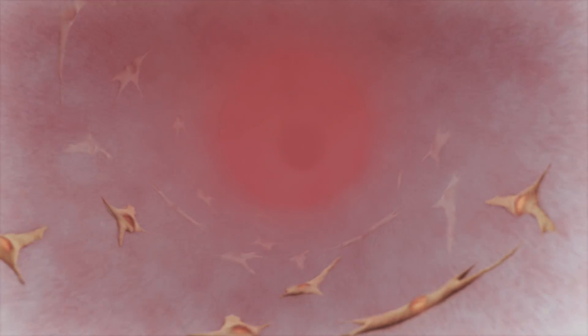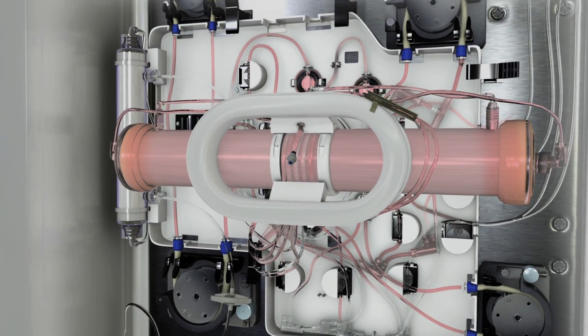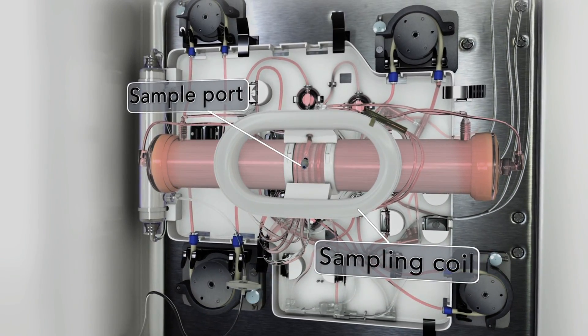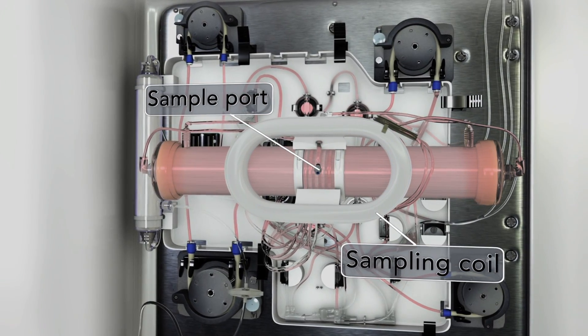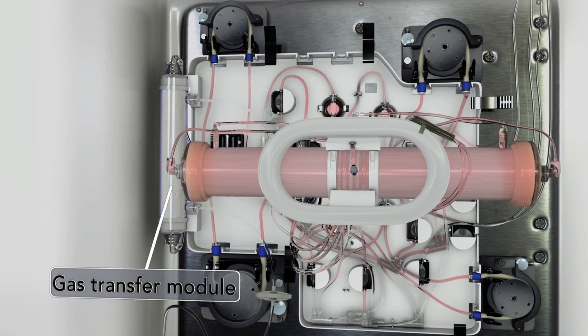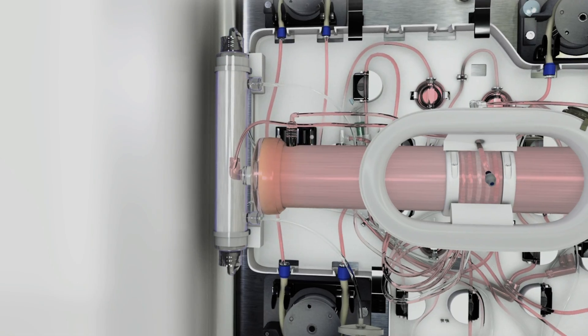Automated cell feeding and waste removal in the temperature-controlled environment reduces time-consuming and labour-intensive steps. In-process sampling allows for monitoring of the cell expansion process for quality management and documentation, minimising the risk of contamination. The gas transfer module stabilises gas concentrations in the cell culture media.